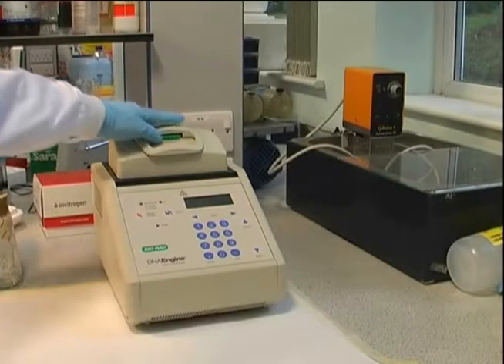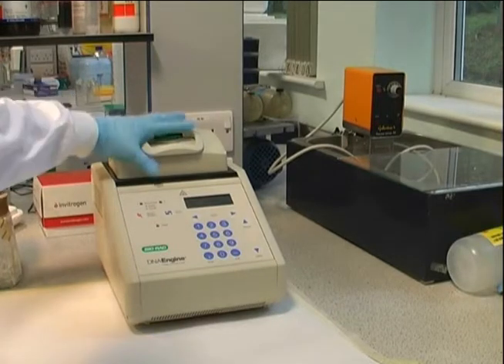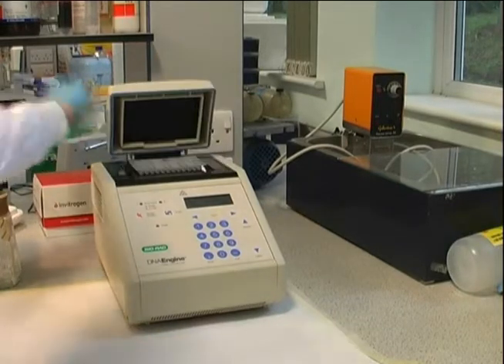Once the thermocycler has run the required number of cycles, samples are removed from the machine, ready for loading onto the gel.